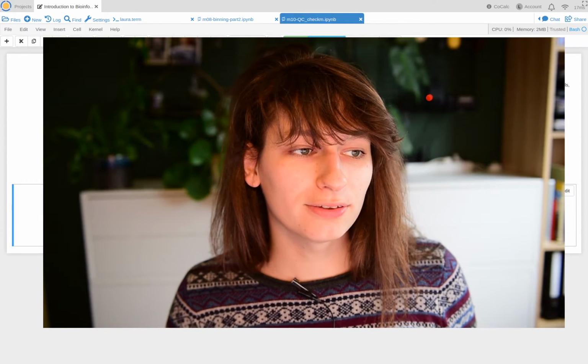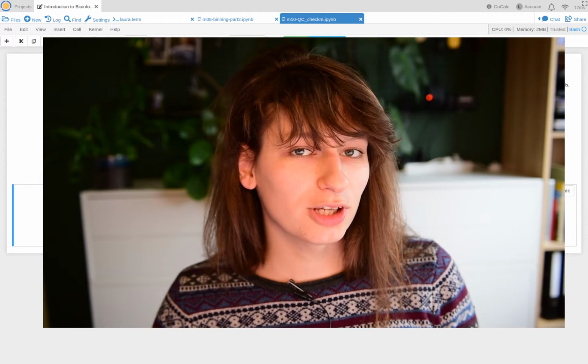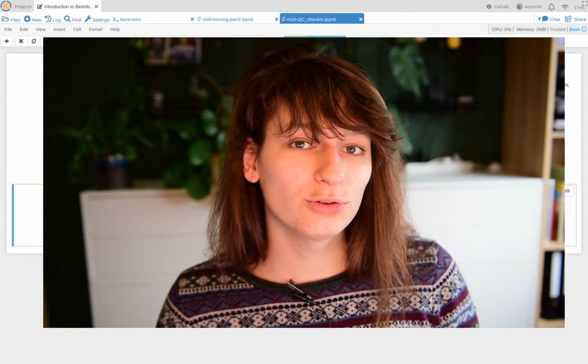I'm now going to look at assignment 10 of topic 2, metagenomics. So in assignment 10, we're going to assess the quality and contamination of our bins using an amazing tool called CheckM.